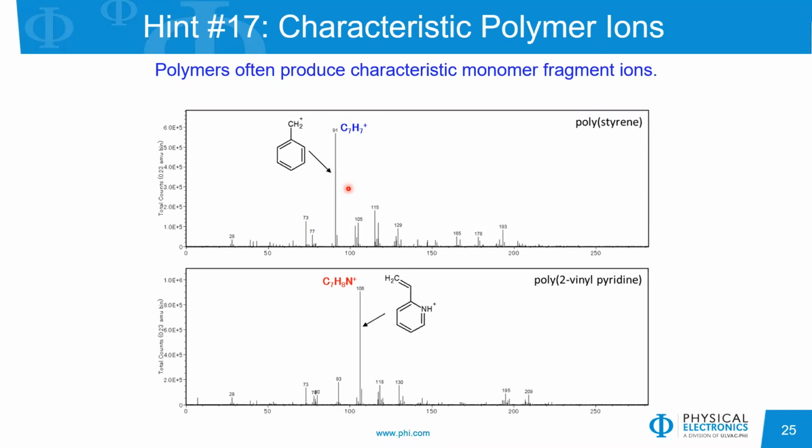we're looking at. So at the top is the low mass to charge region of polystyrene, and we see very clearly the C7H7 monomer. In the bottom spectrum, this is the low mass region for poly 2-vinyl pyridine, and we see this vinyl pyridine monomer group here at a mass to charge ratio of 106.